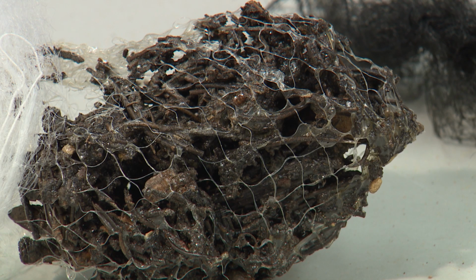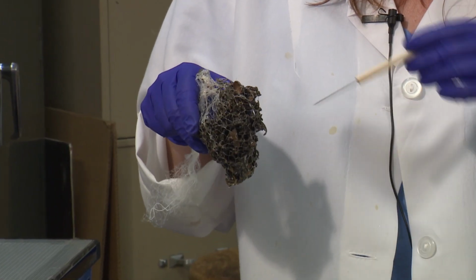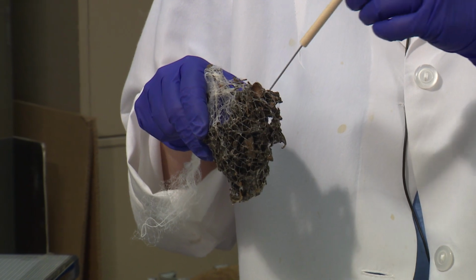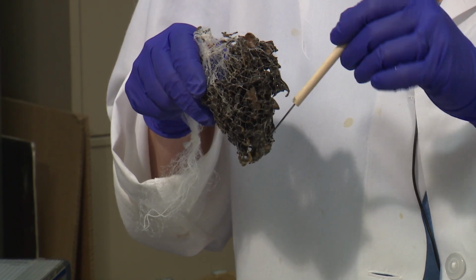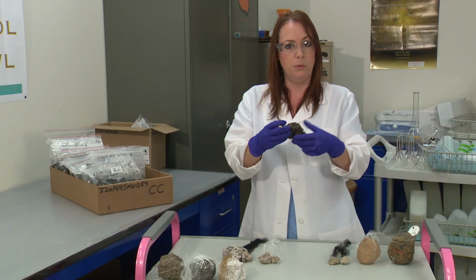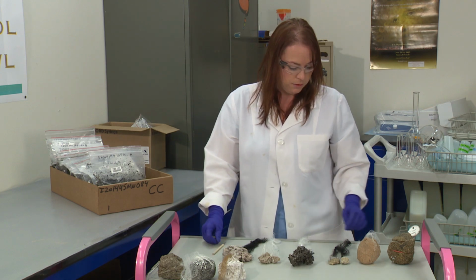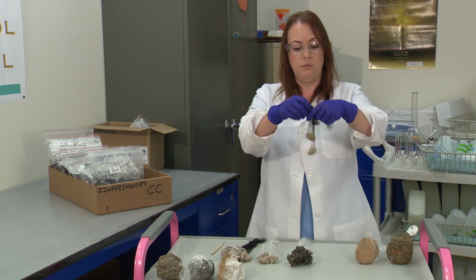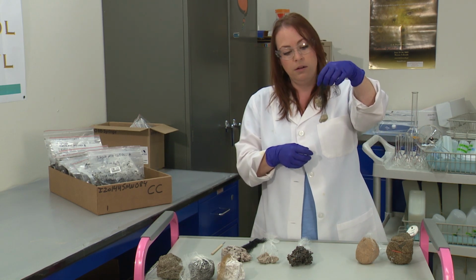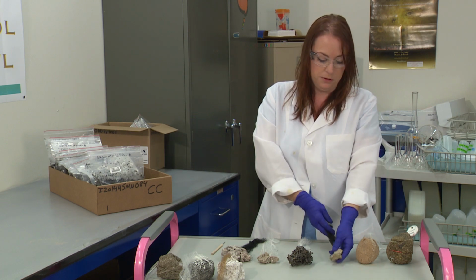Here's another clod that looks like an O horizon. As you can see, the sticks and twigs, there's a lot of air pockets in here. If we dip this in saran, it's already been dipped in saran, so the saran goes right into these air pockets, and it's full of saran, and we don't get good bulk density with these. This would be more of a compliant cavity. Here's a couple clods that came in that are just definitely too small. There's nothing that I could do with this clod here. It wouldn't give me good results.